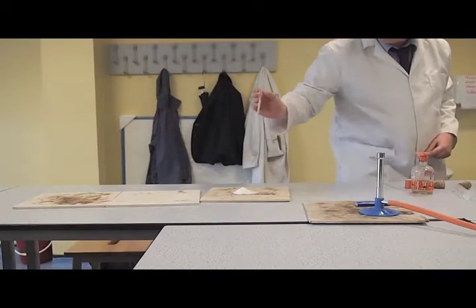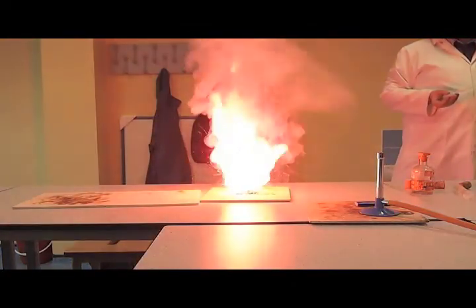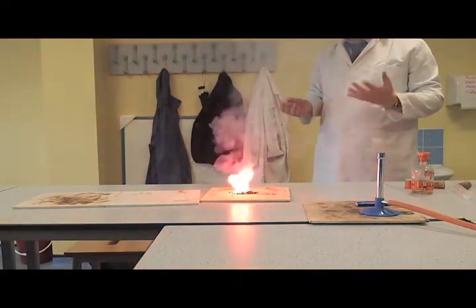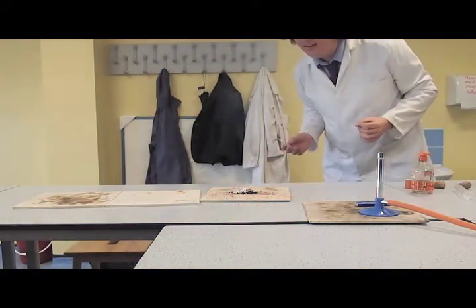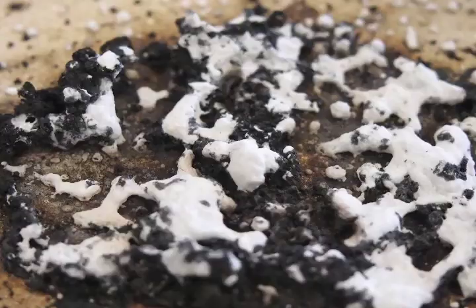Pretty! So hot! We're seeing exactly that same red colour as we saw with the little flame test, just slightly more exciting. Right, so that was the strontium. Oh, it smells of chlorine.